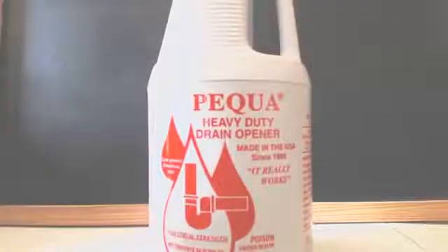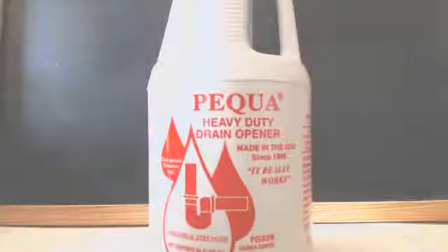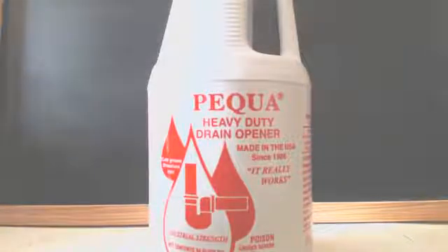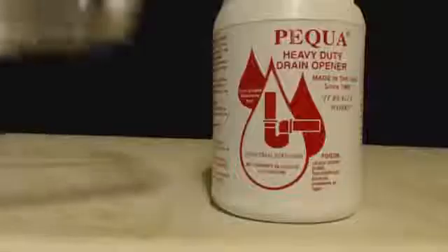I looked up the MSDS - it says it's 45% potassium hydroxide, 55% water. Now there's some type of corrosion inhibitor in here. You can tell because when I pour it out it'll be like a bluish-green color. That's an iron coordination complex.